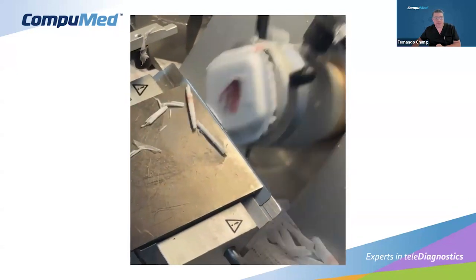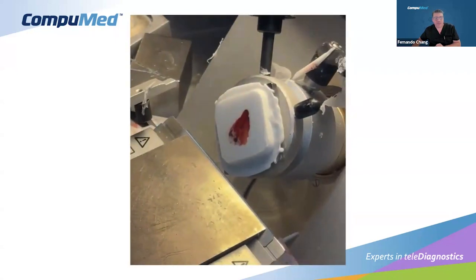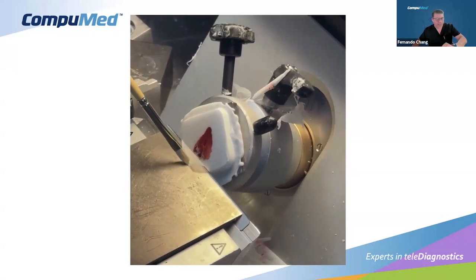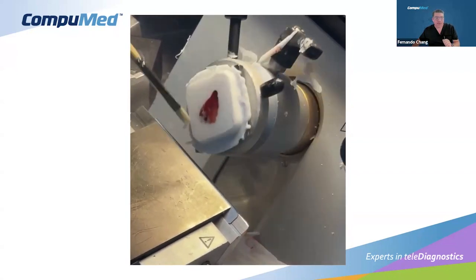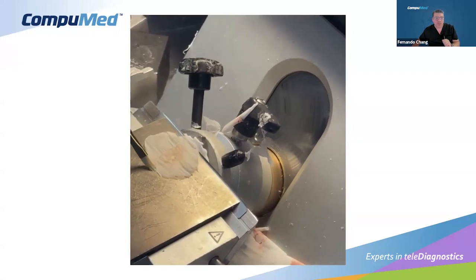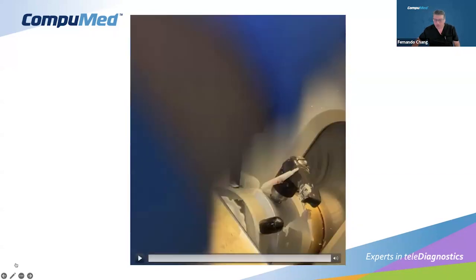And you can see the plastering. And now the tissue is right at the edge. Okay, so this is just to show how these sections are made, and then the section will be placed in the fixative immediately.